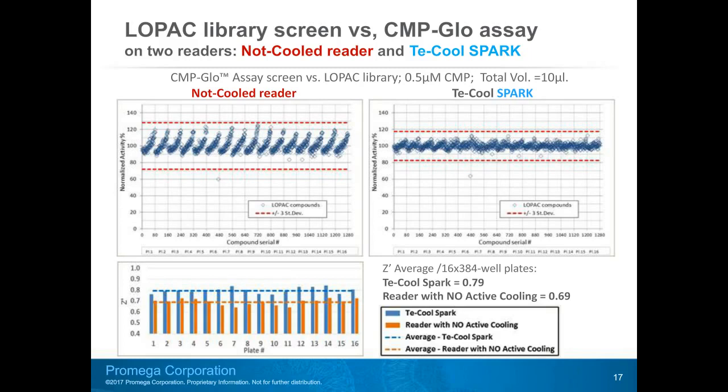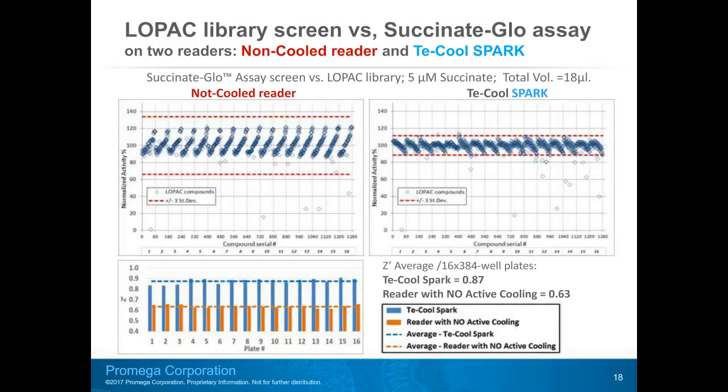The lower bar chart shows Z prime values for each of 16 plates. Reads on the T-cool instrument are shown as blue bars, and reads on the not cooled reader are shown as brown bars. All blue bars are significantly higher. The average Z prime value for the 16 plates obtained on the T-cool equipped instrument, blue dash line, is 0.1 unit higher compared to the average Z prime value for a not cooled reader, light brown dash line.